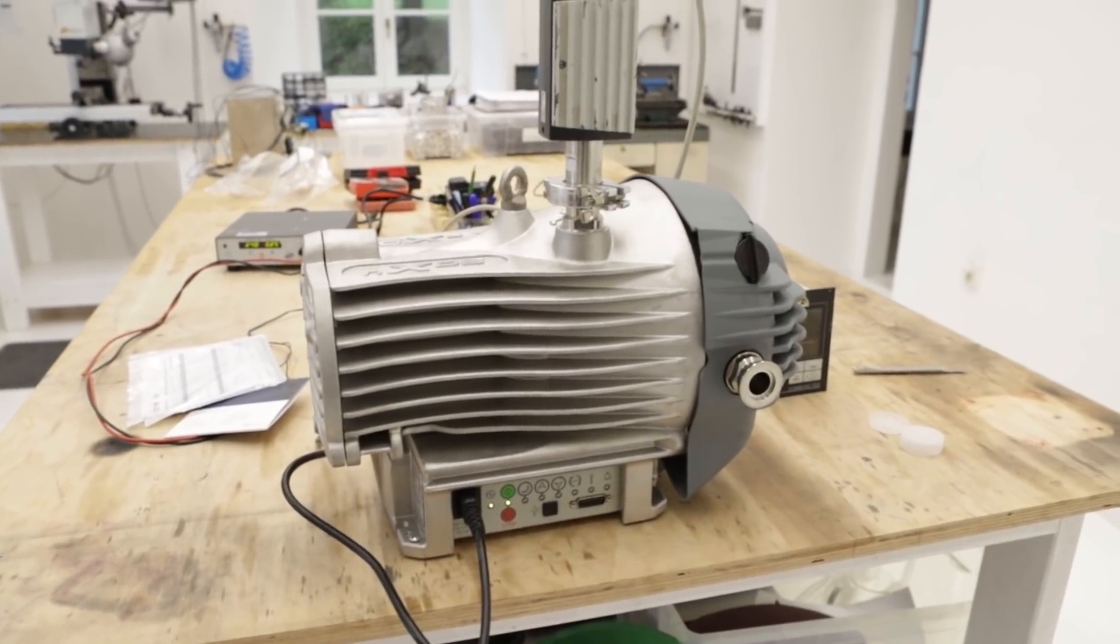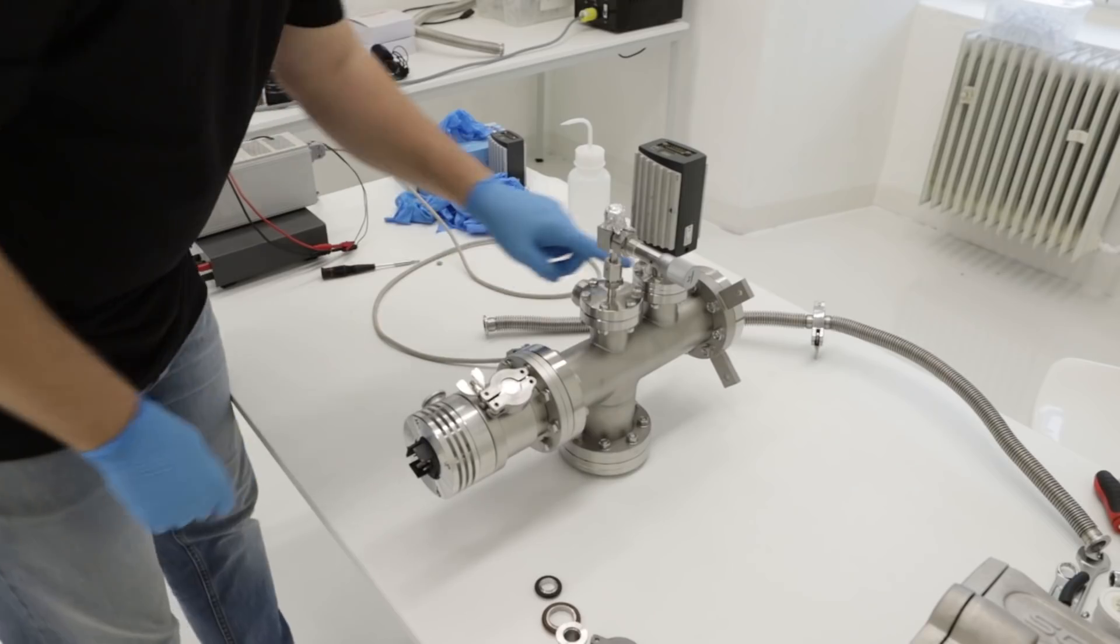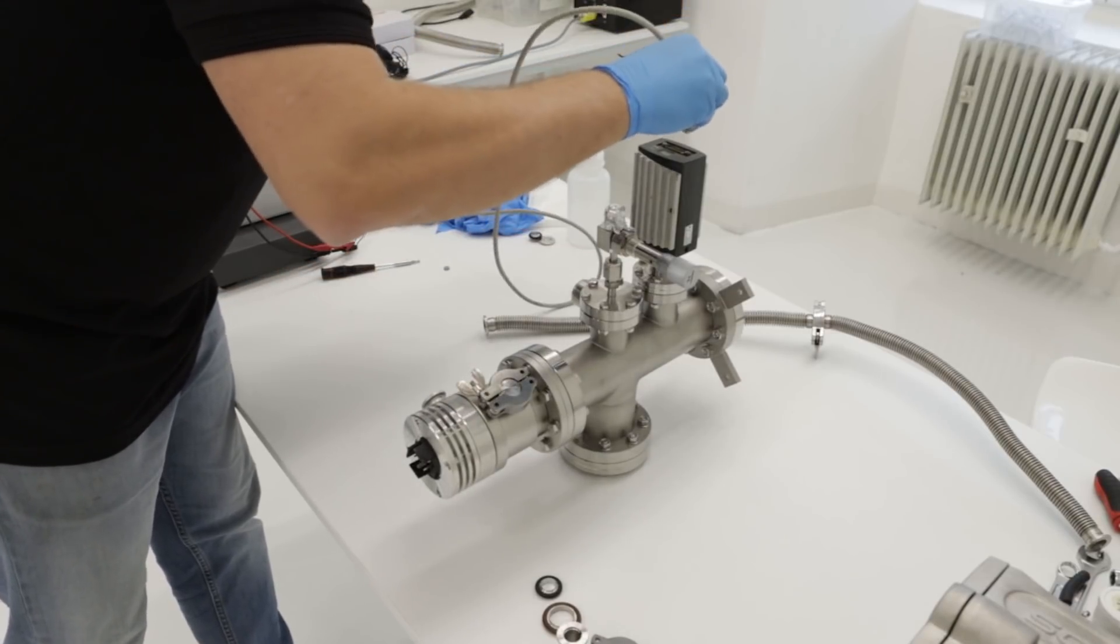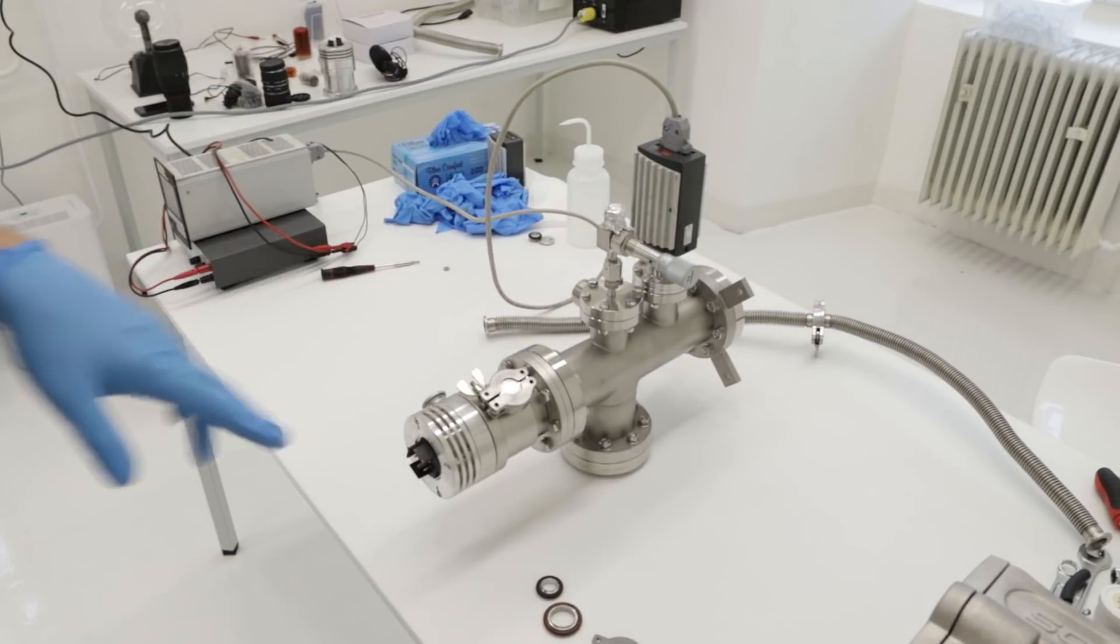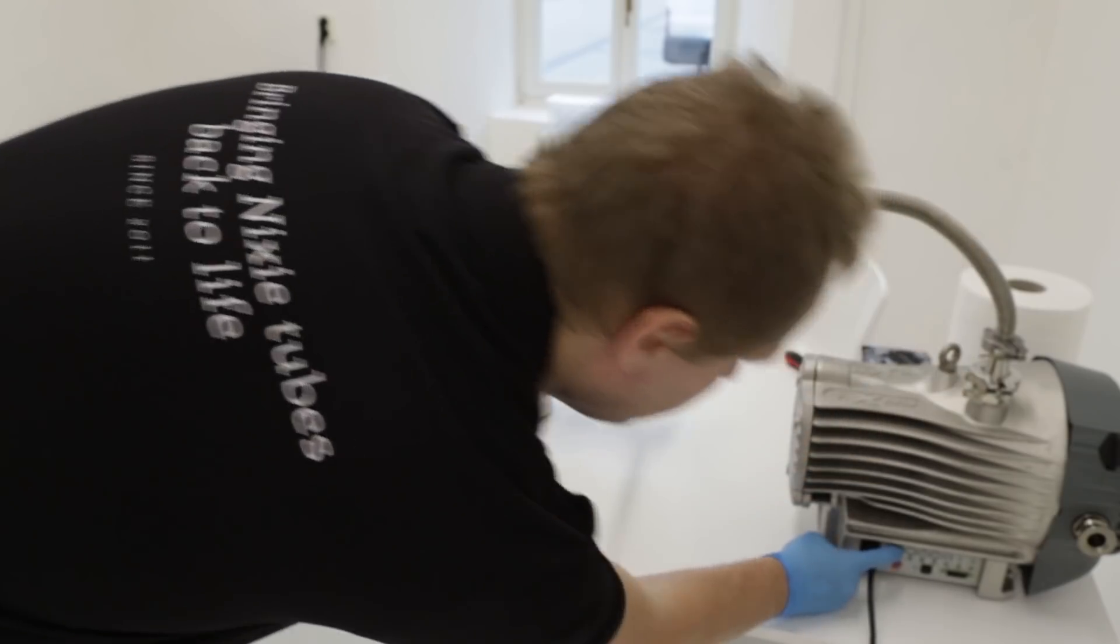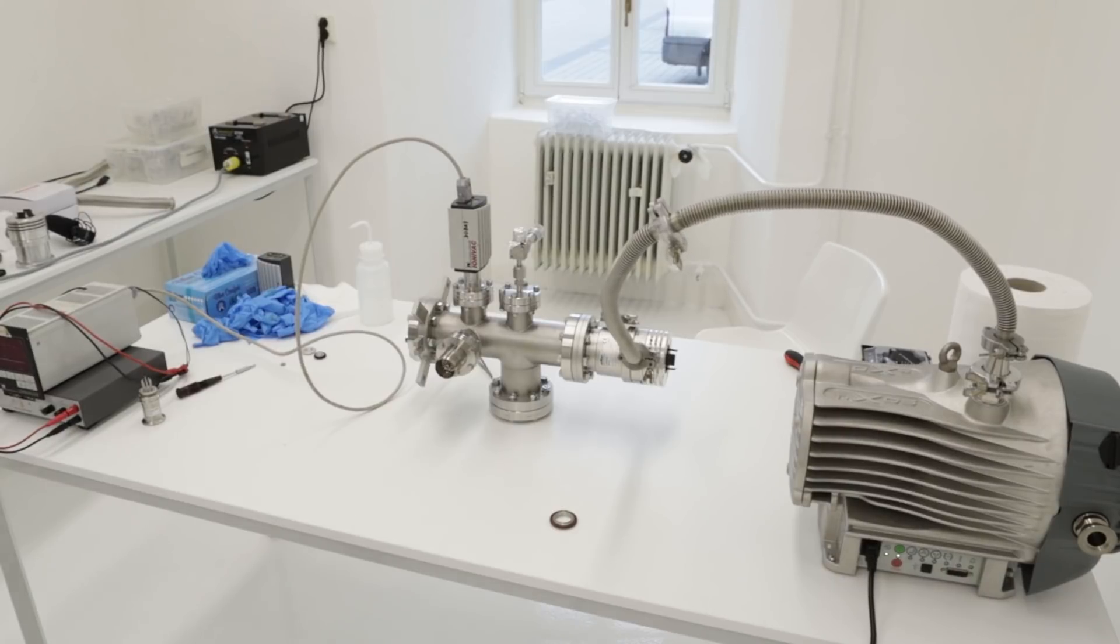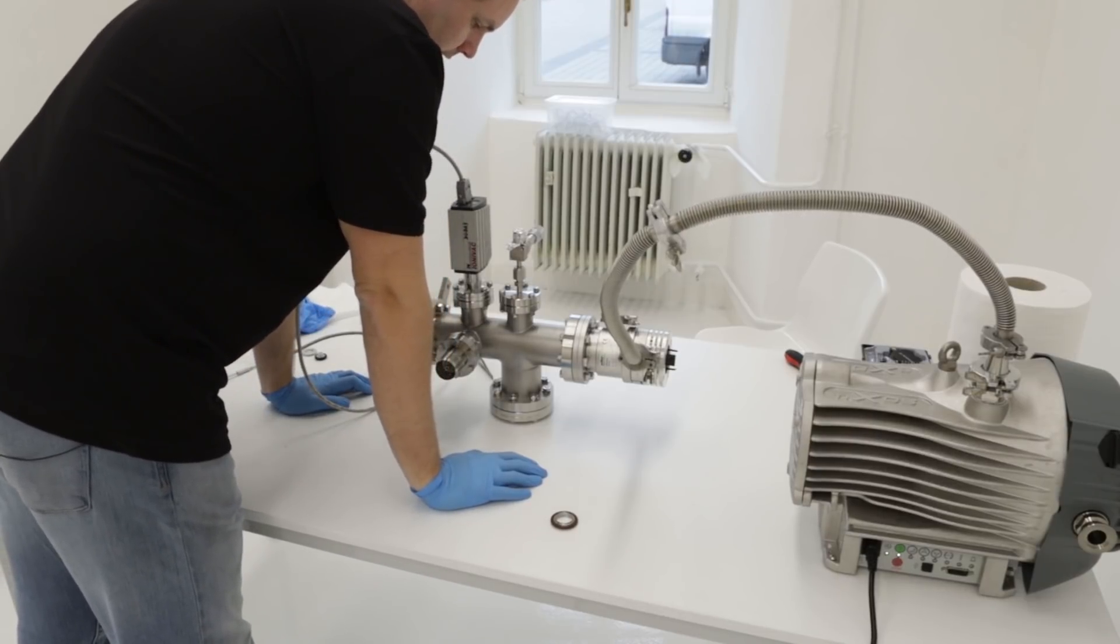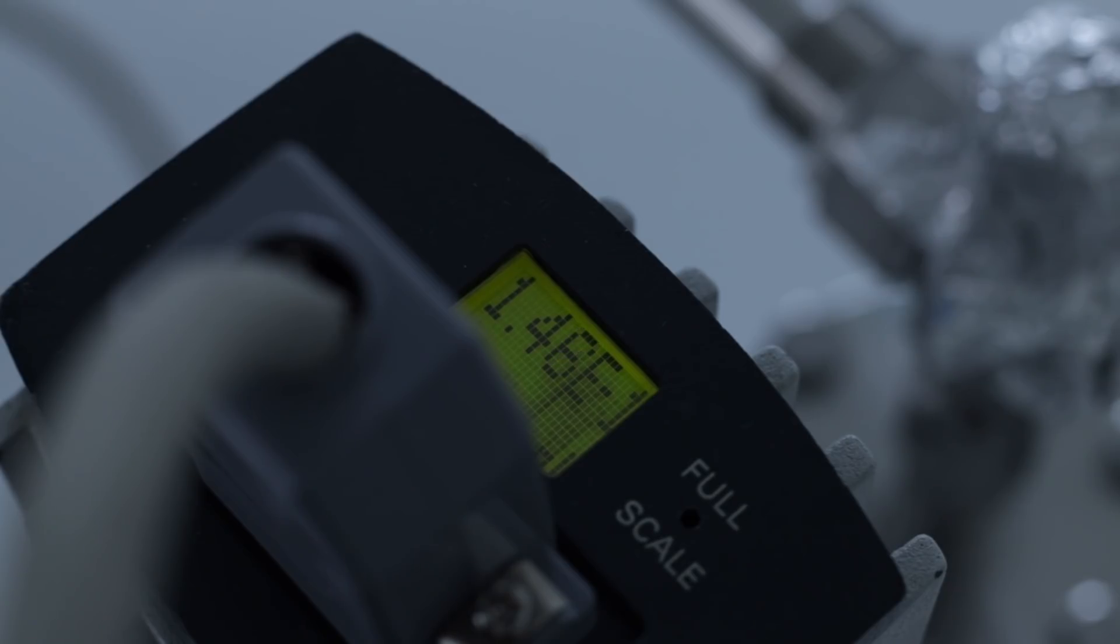I have just one sensor with CF flange and the other ones are with KF, so let's hope it works. Moment of truth. It's glowing red which is never good. Yes, it works. I like how silent the pump is. It's really a difference compared to oil pumps.